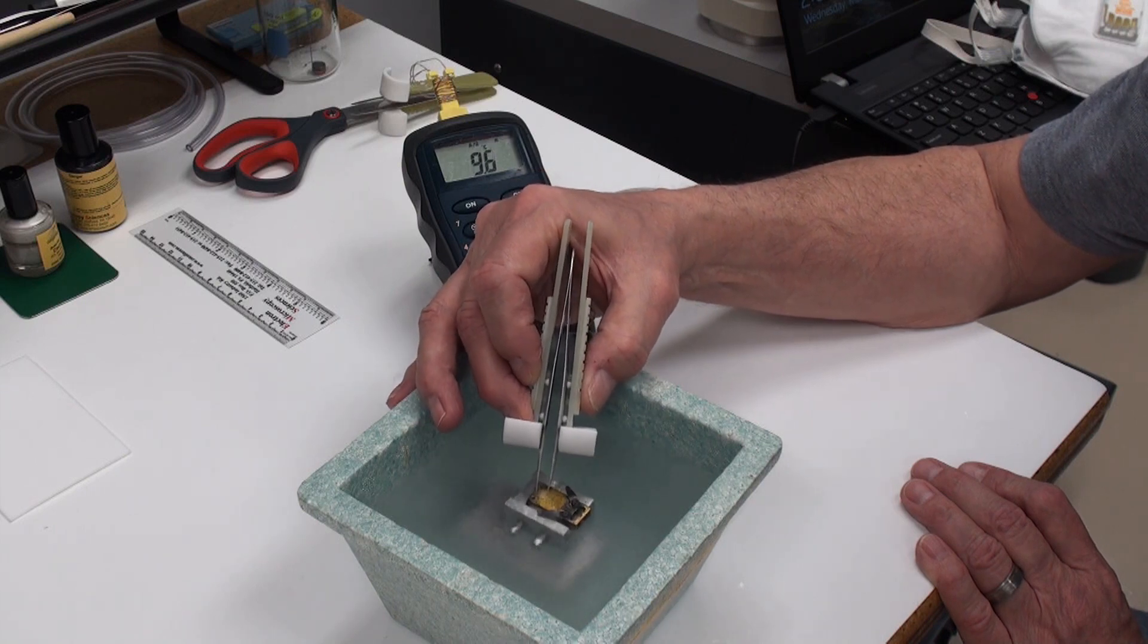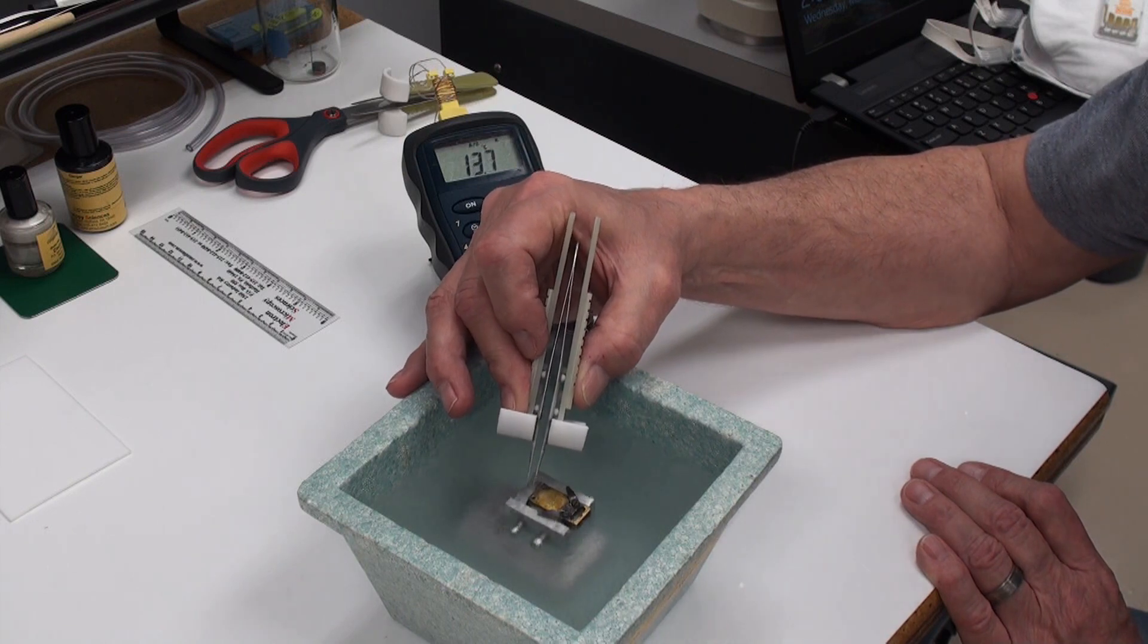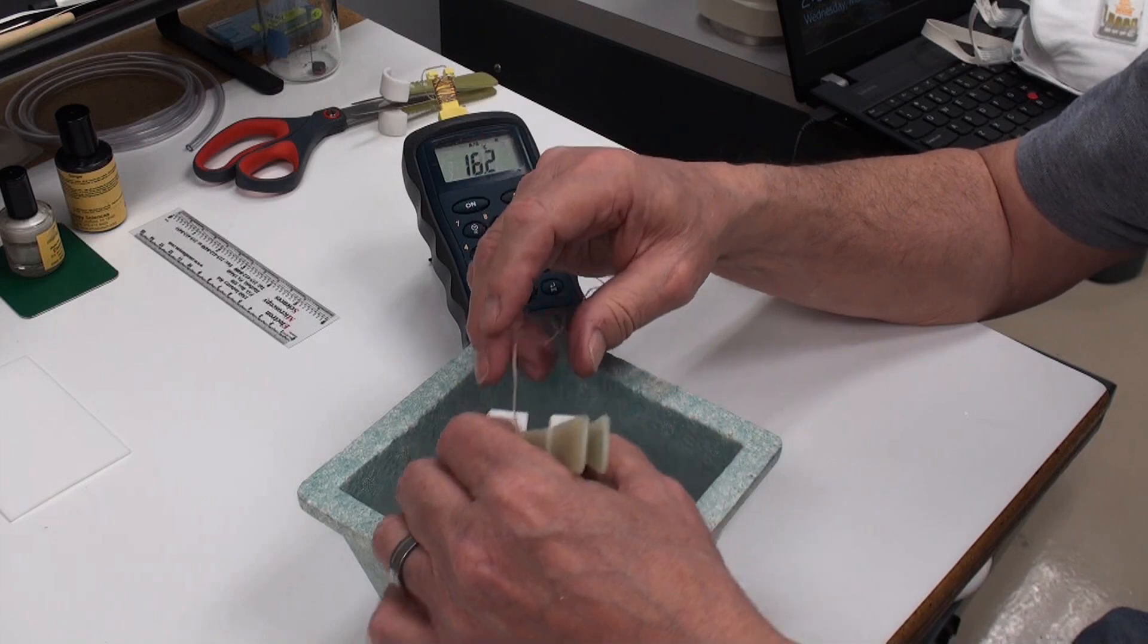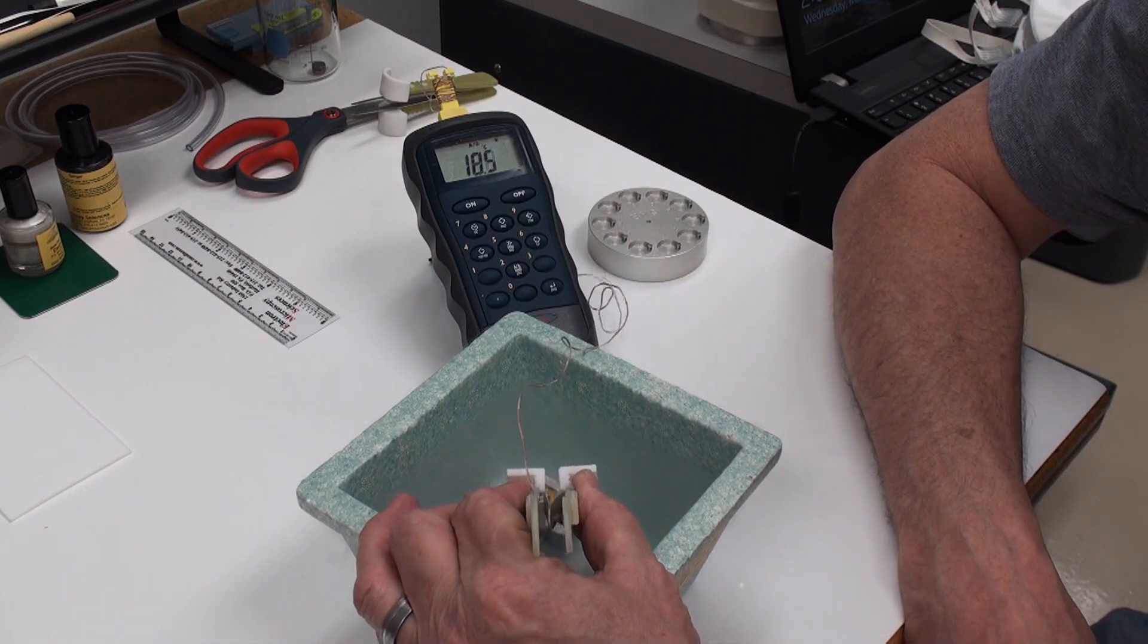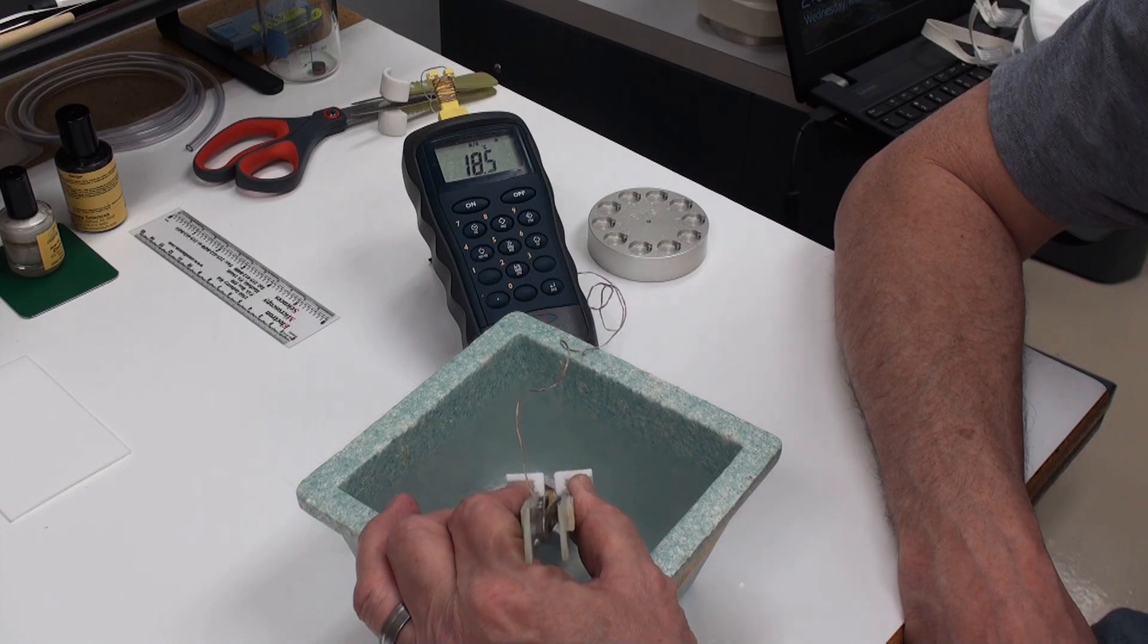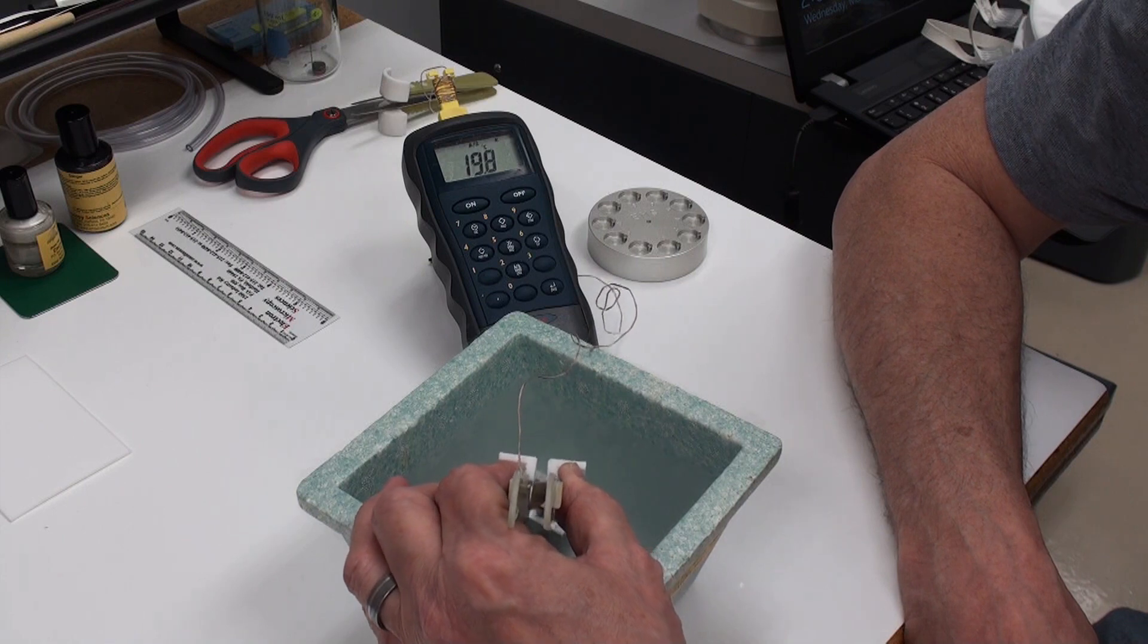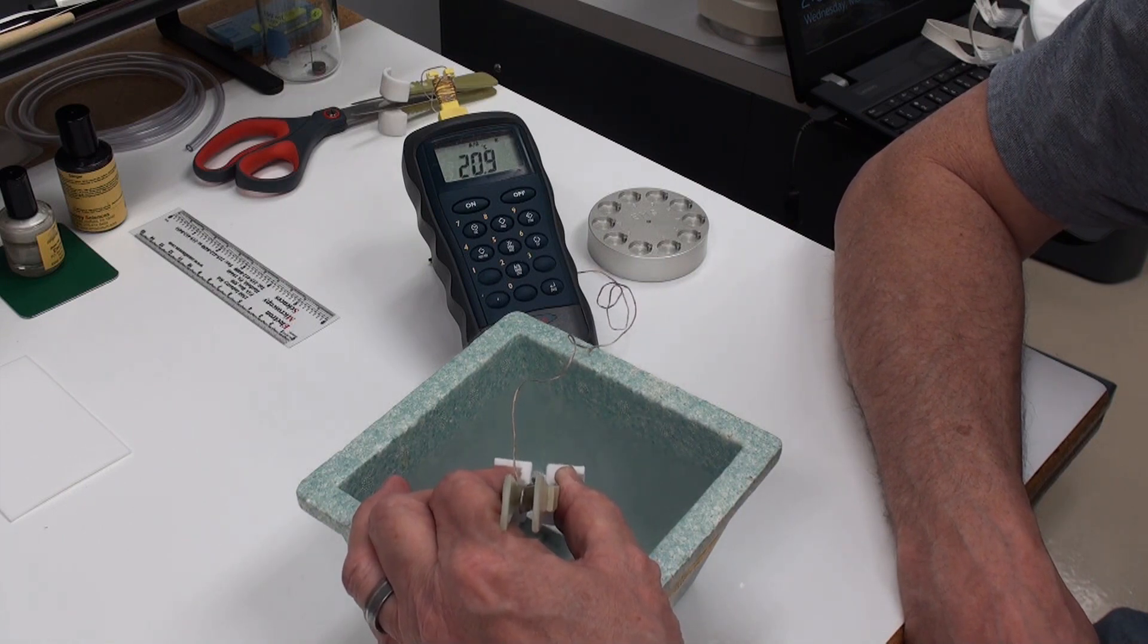But working a little bit shallower, you can see right away the temperature comes back up. I'm left-handed, so this is a bit awkward, although I can use my right hand. But basically this will allow you to work with grids and such with a little bit more comfort and time.